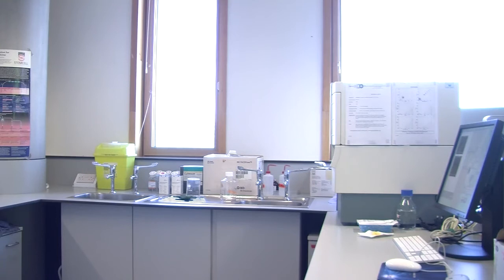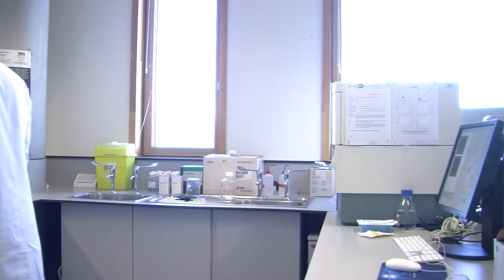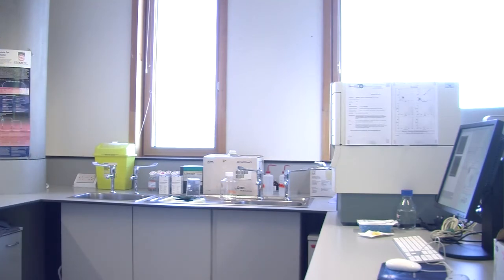Those of you who are doing the isotype matched control, when you add that in, you will get some natural stickiness, but no specific binding. So you will incubate, you'll run those first, and we'll say, right, this peak here indicates no specific binding. When we run the other 3 sets of samples that have the actual antibody, any shift to the right of our no specific binding peak indicates actual binding. It has to be. Okay? Are you all right with that? Yeah, it is. It's calibrating our experiment.